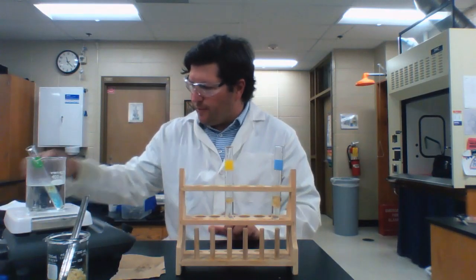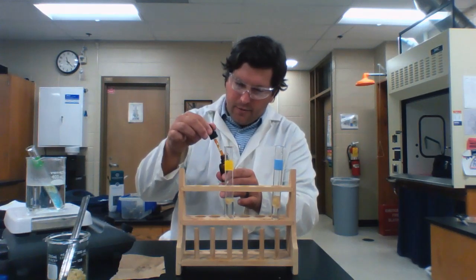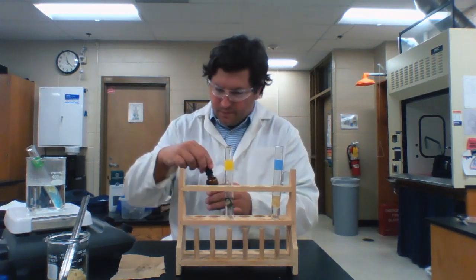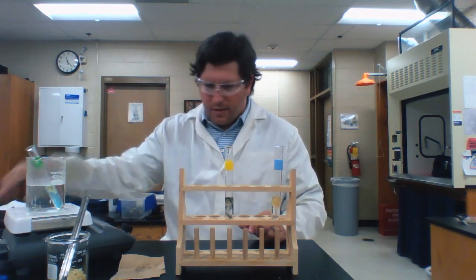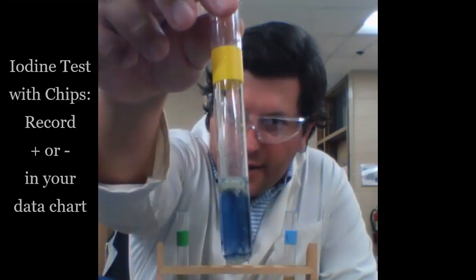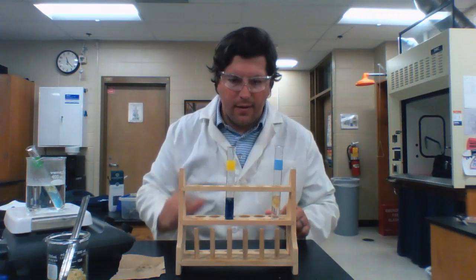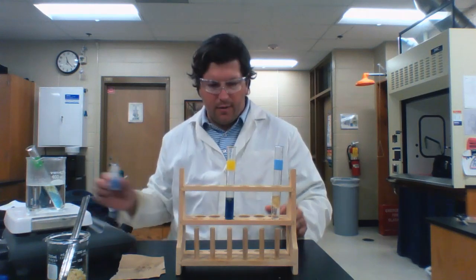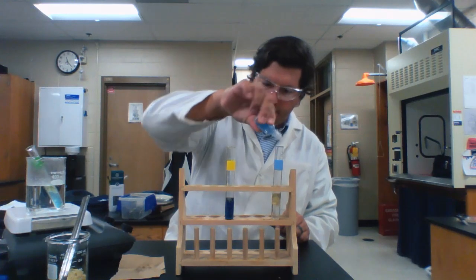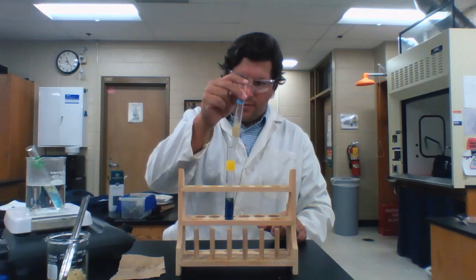Okay, next I'm going to perform the test for starches, again using iodine. Put a couple drops in there. Give that a little mix. And next, I'm going to test for protein using my biuret. So put some biuret solution in there. Give that a good mix. And we're going to let that hang out.